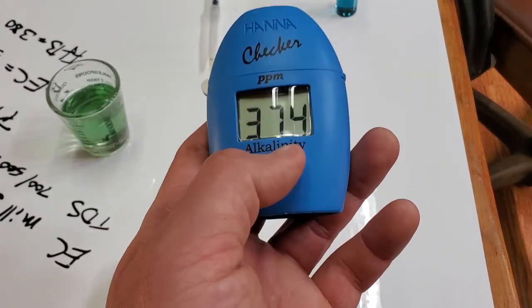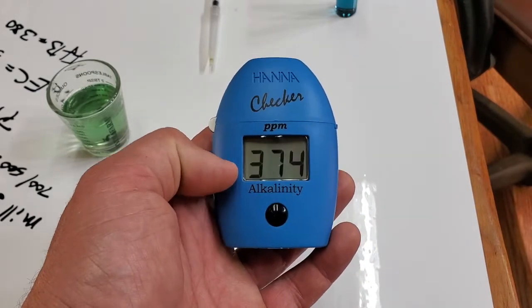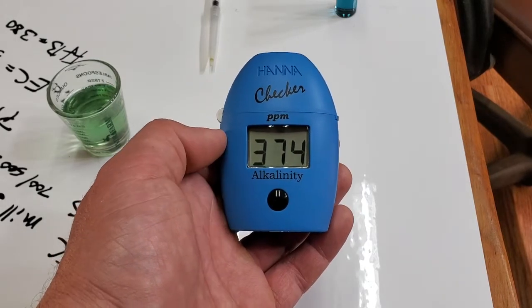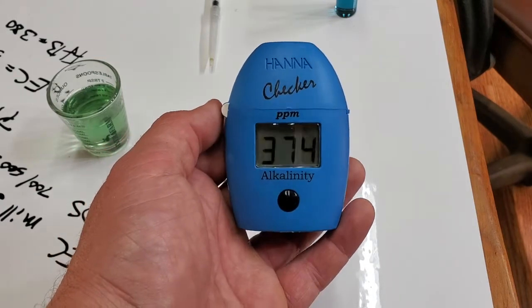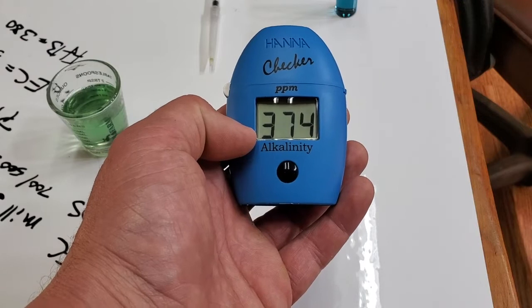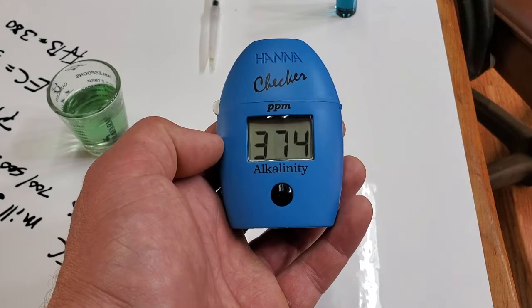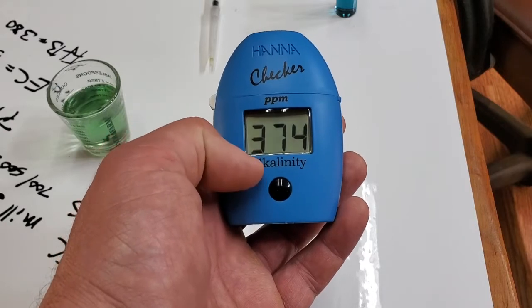Water reading 374 should probably be filtered before use in hydroponics. It's going to be very hard to modify the pH — you'll need a lot of pH down to get it adjusted for healthy plant growth. Below 50 would be considered low, and you'd want to raise alkalinity before adding nutrients, especially in organic or no-till setups. Between 100 and 300 is the optimal range, and above 300 is really hard water that's difficult to manipulate.